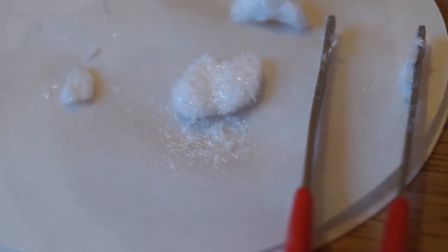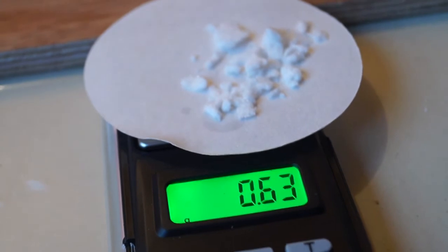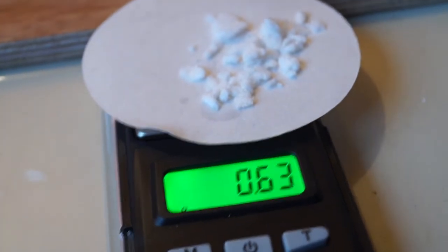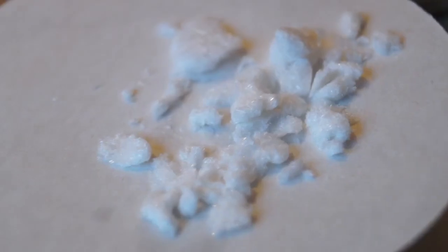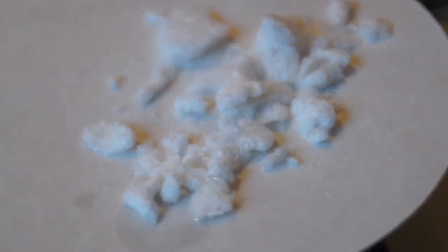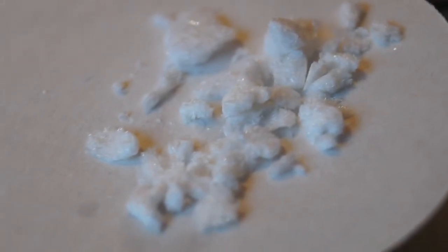From 2 grams of salicylic acid, I achieved a yield of about 0.6 grams of aspirin. And that's how you make aspirin.